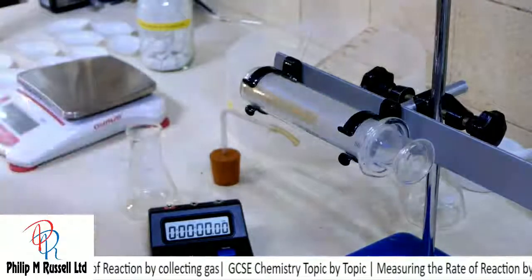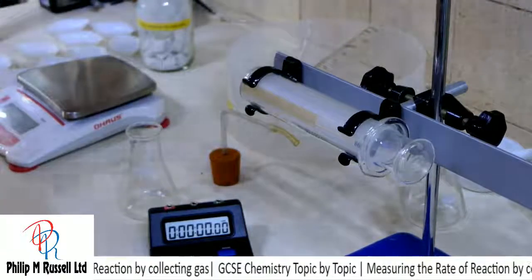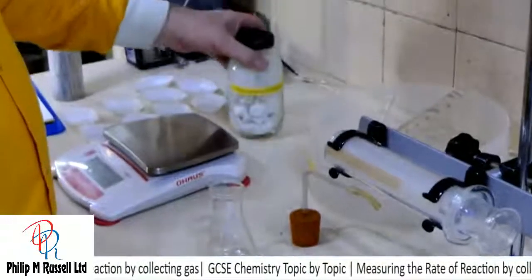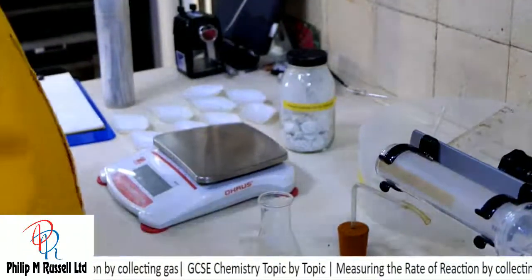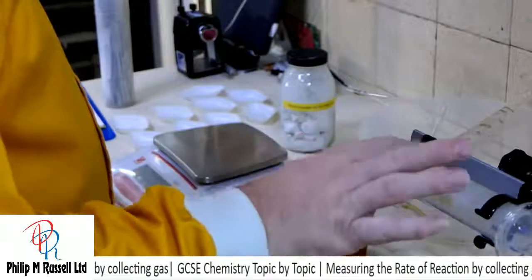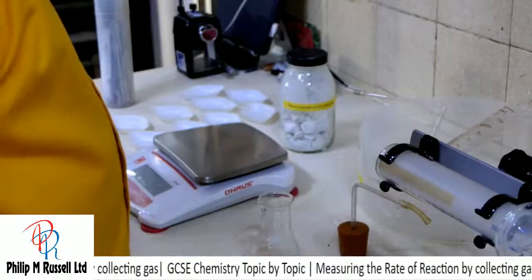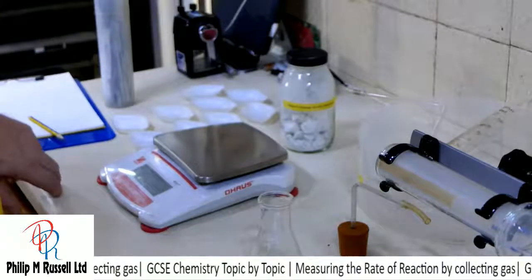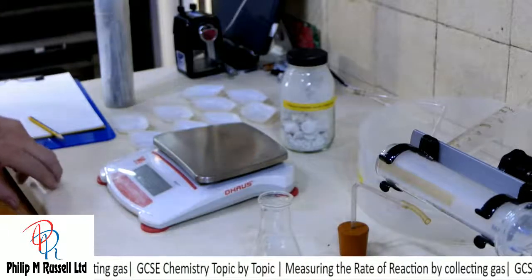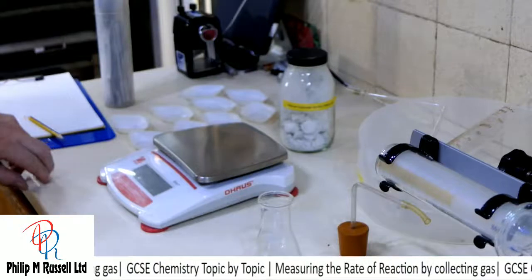So what we need to do is to measure out some calcium carbonate, and we're going to react this with some acid. Last time I used acetic acid, which works quite well.